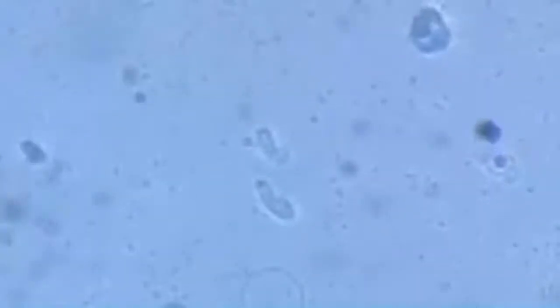Once I'm done with this video, I'll be transferring these individuals to another culture so that they thrive. It's a fascinating hobby, microscopy. It's a very fascinating and a very rewarding hobby.